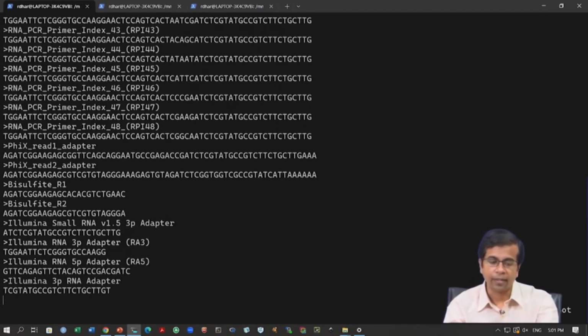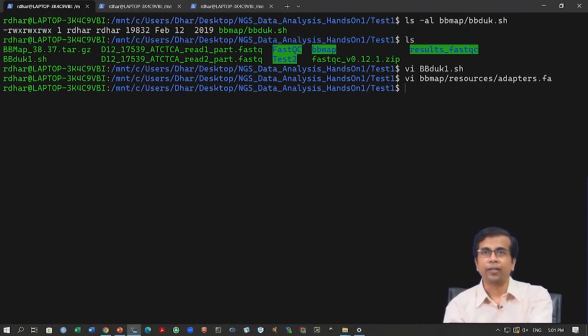You can simply add this in vi. You can simply add a header saying your adapter name, and then give the sequence and just save it with :wq. Here we are not saving anything, we have not written anything, but in case you do modify this file, you can save it with :wq.